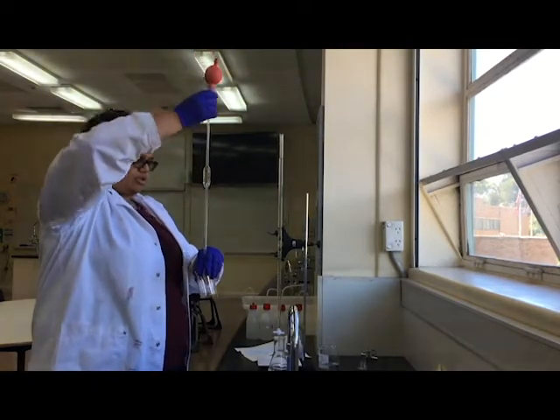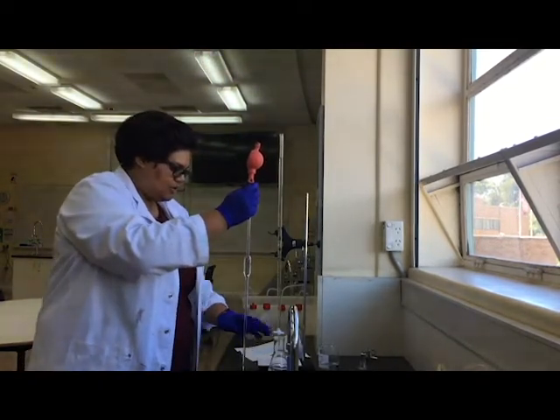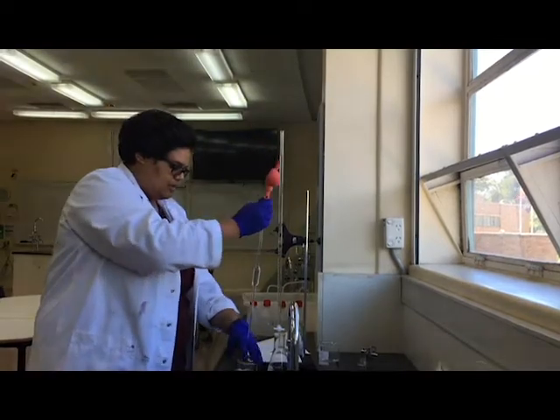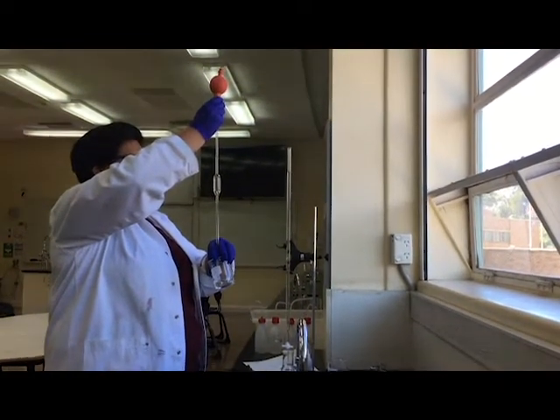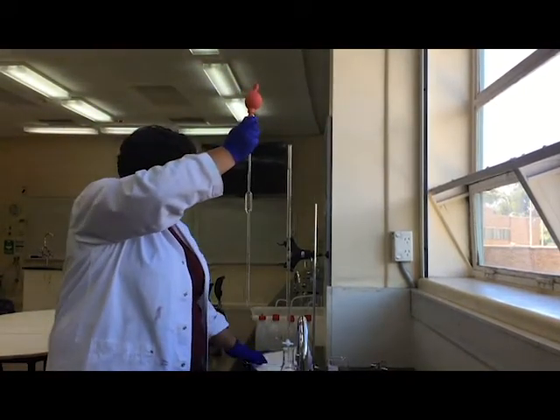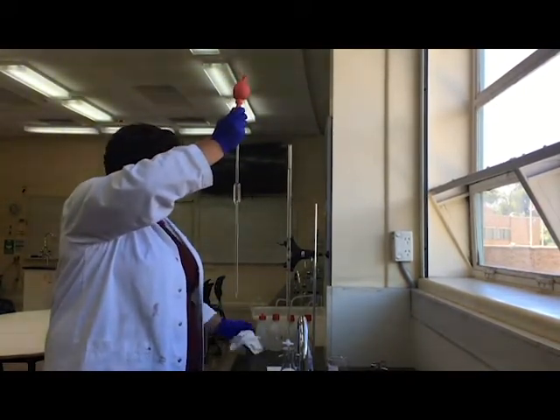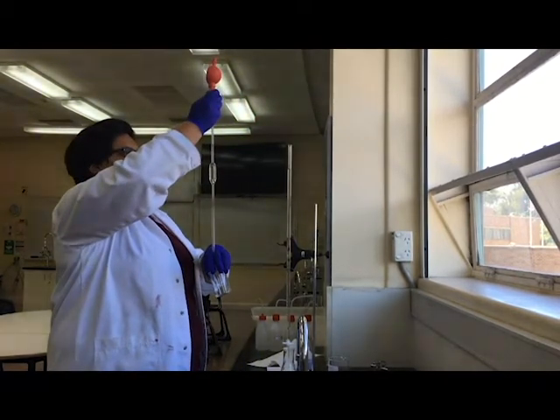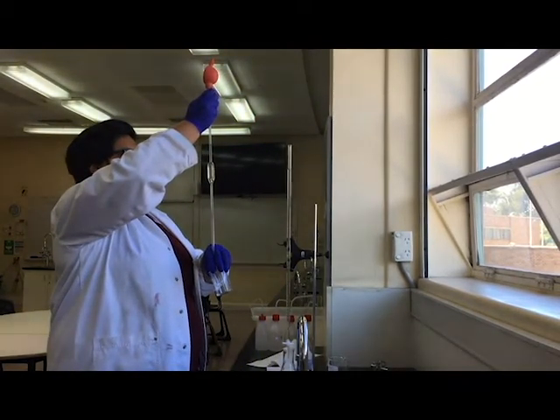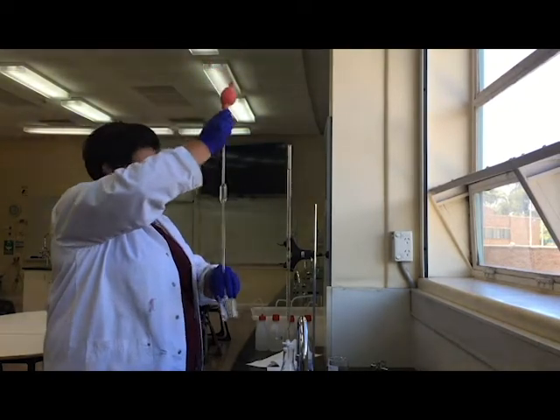If that happens, you just have to go back and get some more acid and do the same step as before. So going back up, it's very important to go over the line and back because that way you get a nice meniscus. If you just suck up to the line, you won't get the meniscus forming. So very gently, oh there we go, perfect.